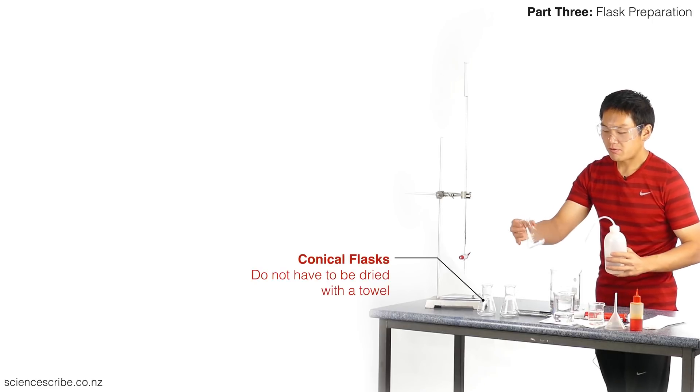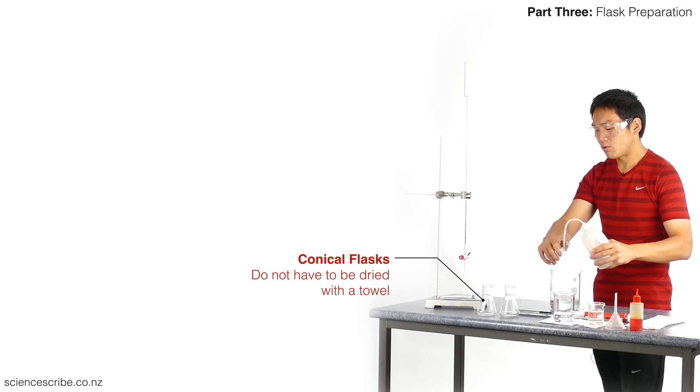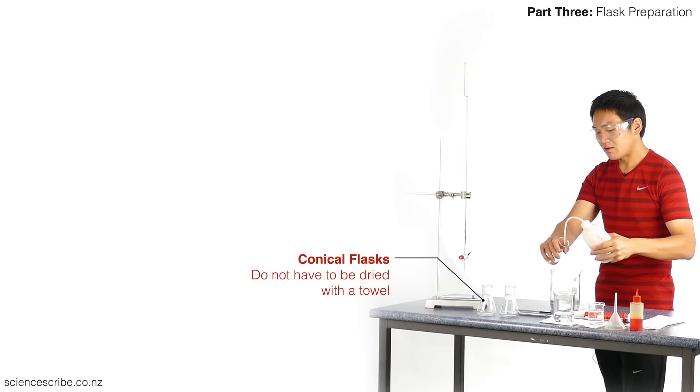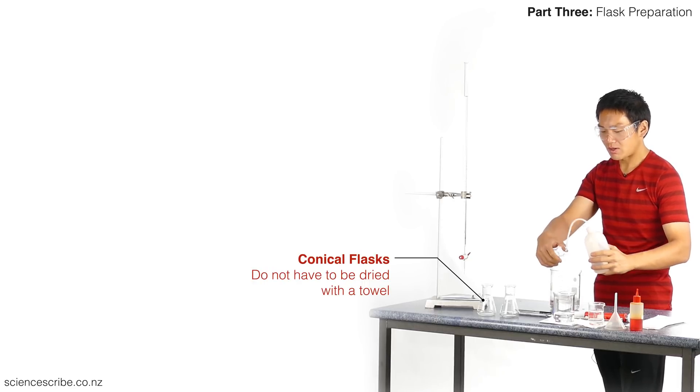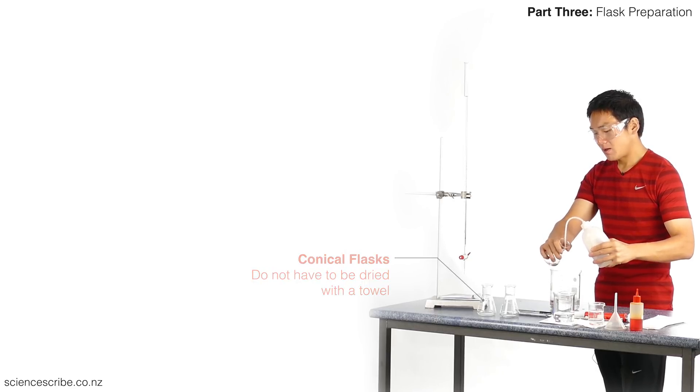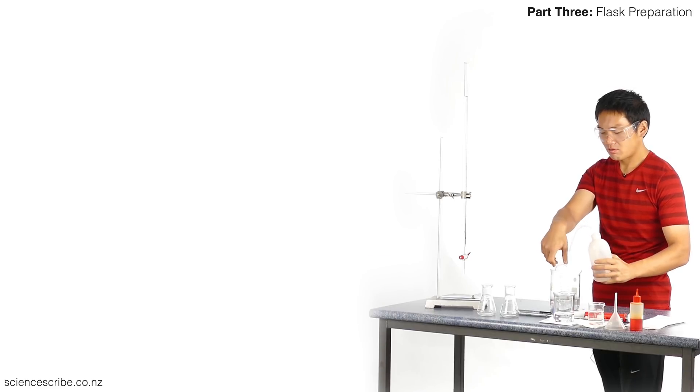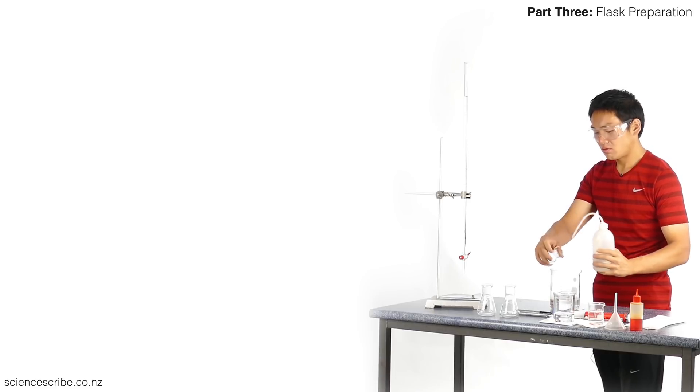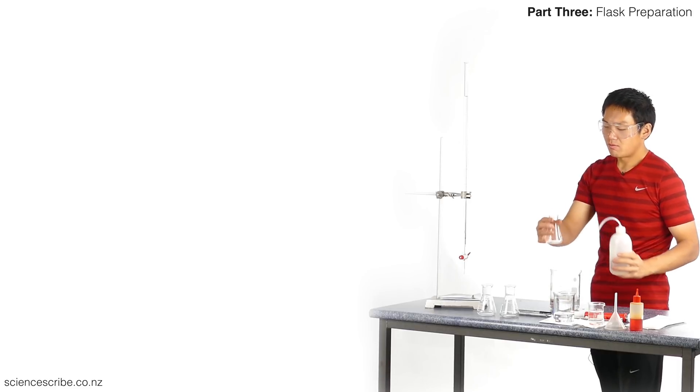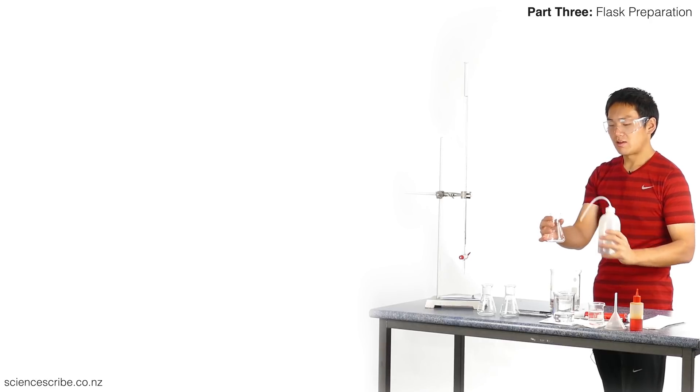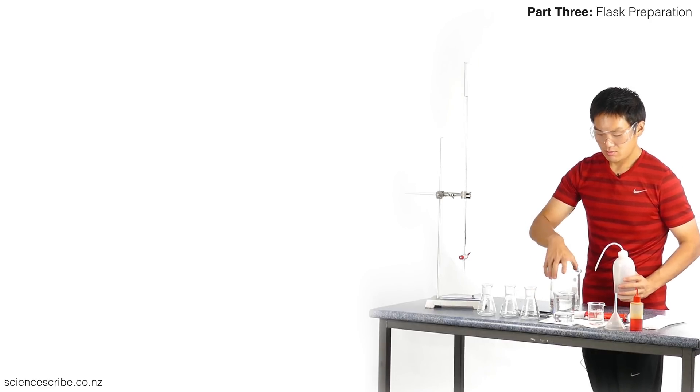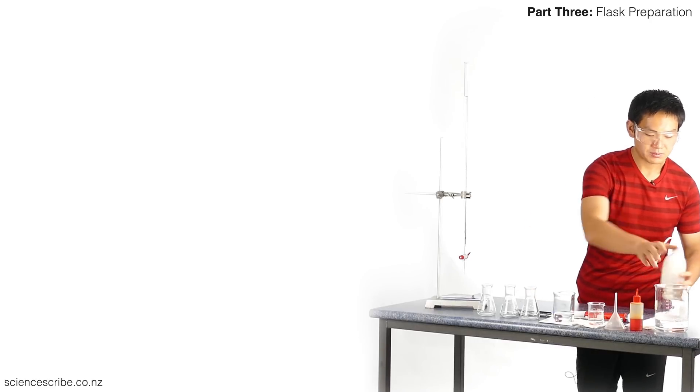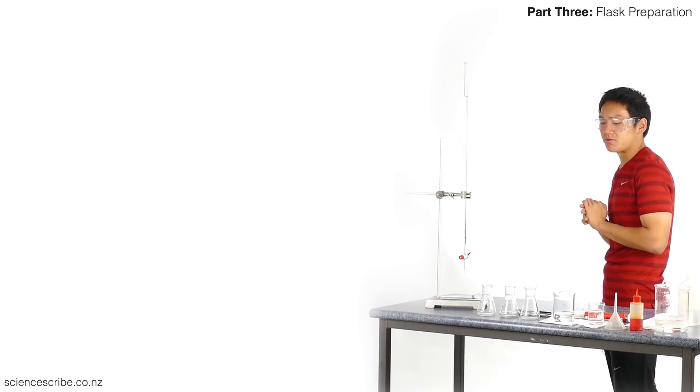Conical flasks you don't have to dry. I always see people drying their conical flasks off with a paper towel—it's not necessary, so don't waste your time doing that. Second rinse for this one, third rinse for this one. Remember, we aim to get as much of the wall down as possible.